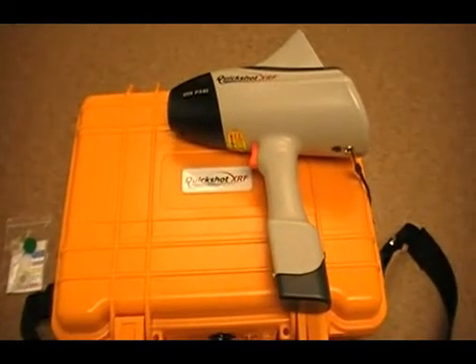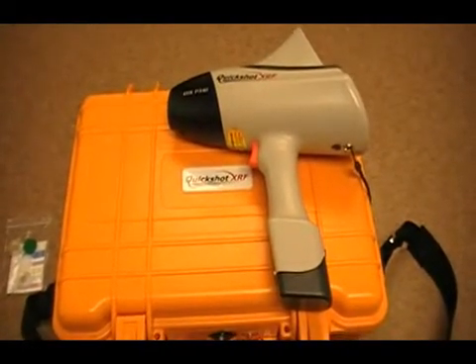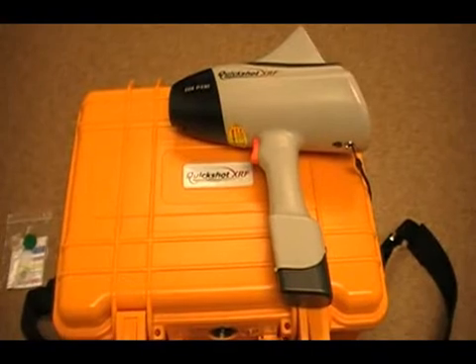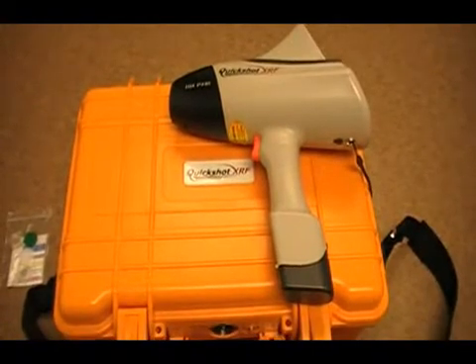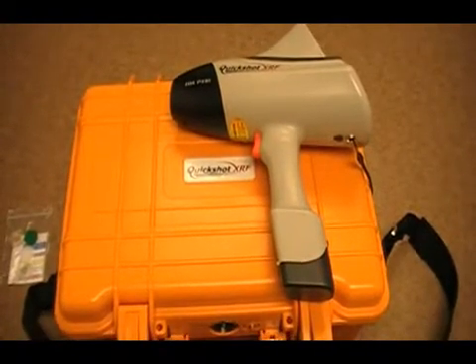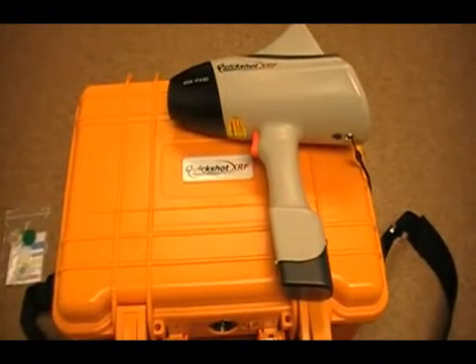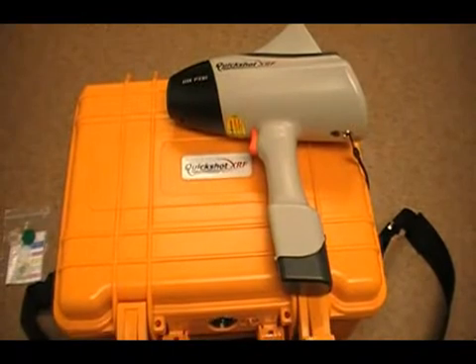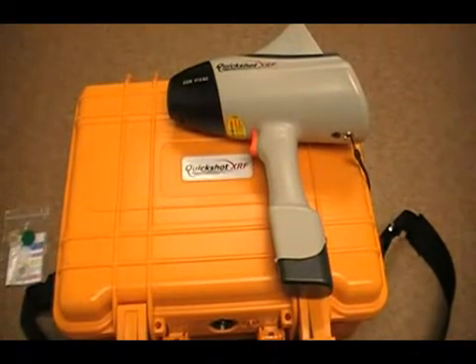Hello. You have already seen the overview videos as well as the video on the accessories that come with the QuickShot handheld unit.